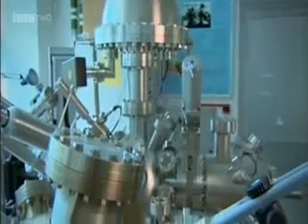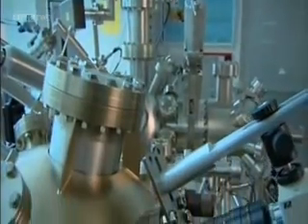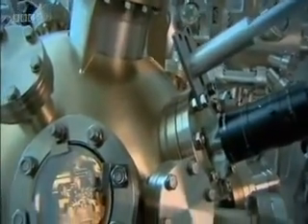Now a new type of electron microscope, a tunnelling electron microscope, has even made it possible to see the arrangement of atoms. Just how far will microscopy go?